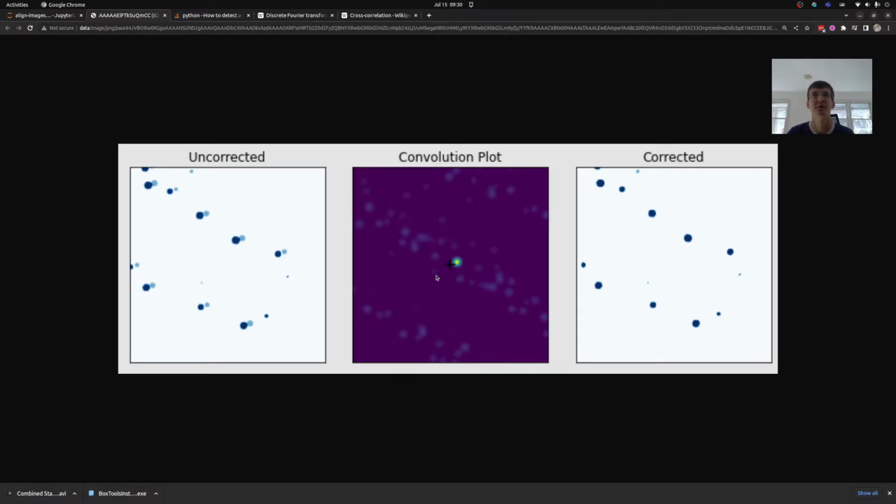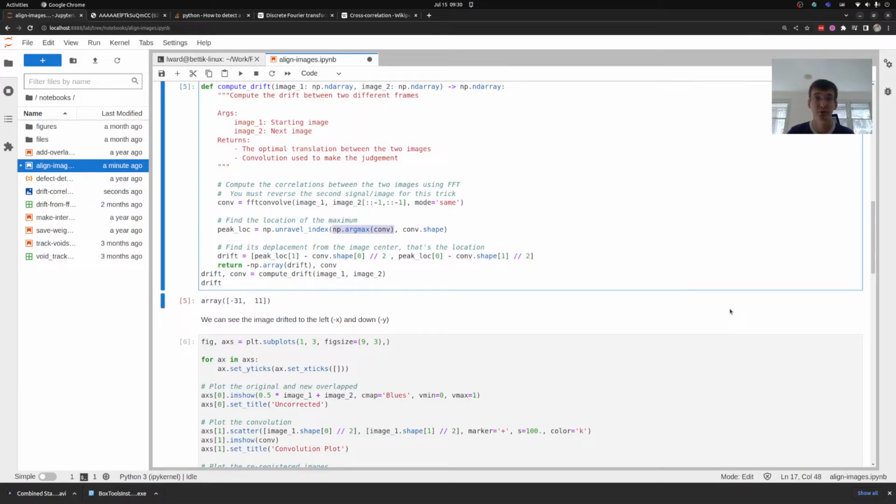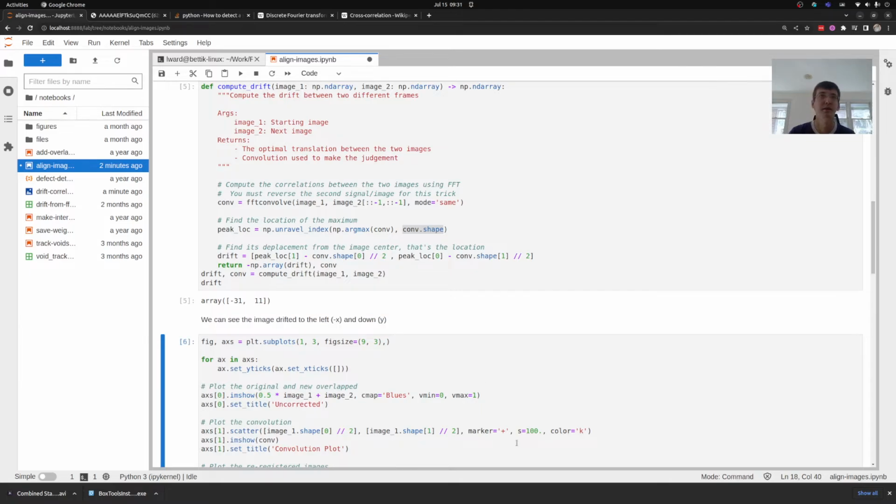My convolution plot is going to give me that cross-correlation signal, and I need to pick out where the maximum of that signal is, which we can see is about here. The way you do that is you compute the location of the maximum using argmax. That's going to give me a position in the list, counting row-wise. It's going to be a single number, not 2D coordinates, and I can convert it to a 2D coordinate using NumPy's unravel index, given that one-dimensional coordinate and the shape of the array. I can then take that peak location and compute where that is in reference to the center. I'm taking the negative; it's slightly to the left, negative x, and down, positive y. And that gives me my offset.